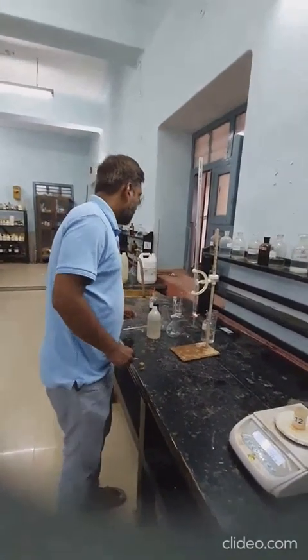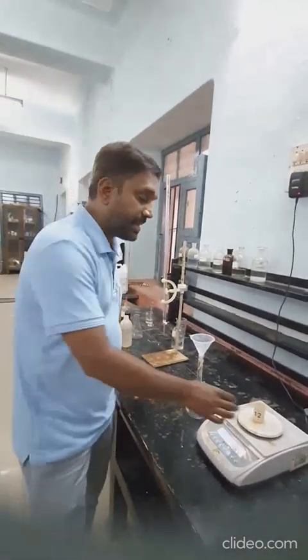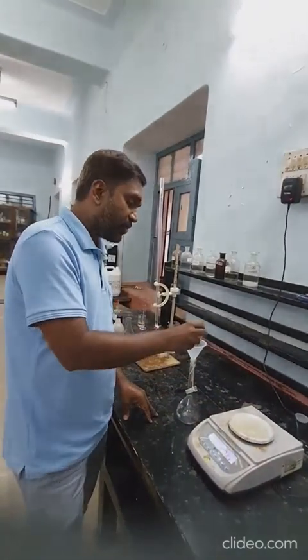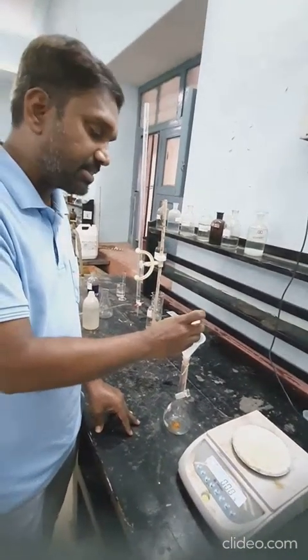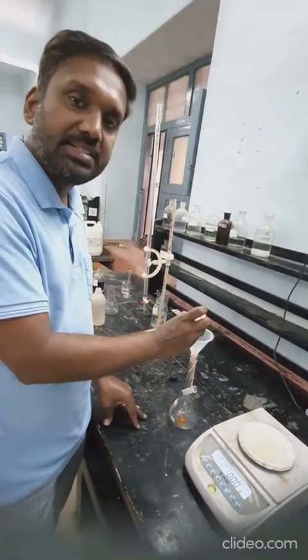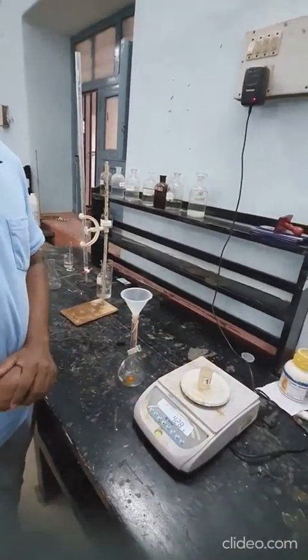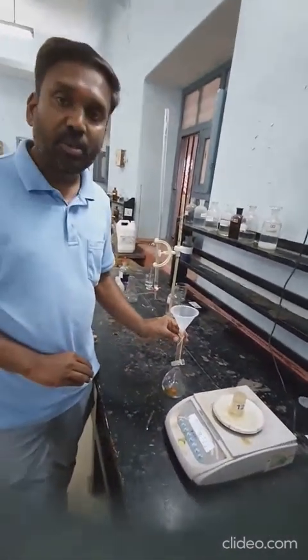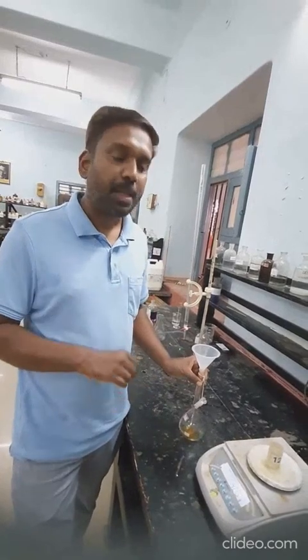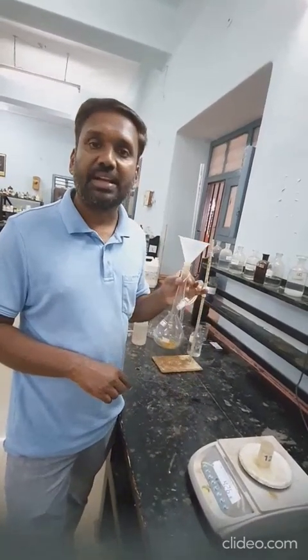Then transfer the given crystals from the bottle into your standard flask. While transferring, after you pour the solid into the flask, just gently tap two or three times so that the crystals fall into the flask. Now take the weight of the empty bottle. The weight of the potassium dichromate you have taken will be the weight of the empty bottle plus crystals W1, minus only the weight of the empty bottle W2. So W1 minus W2 will give you the weight of the dichromate crystals you have taken.